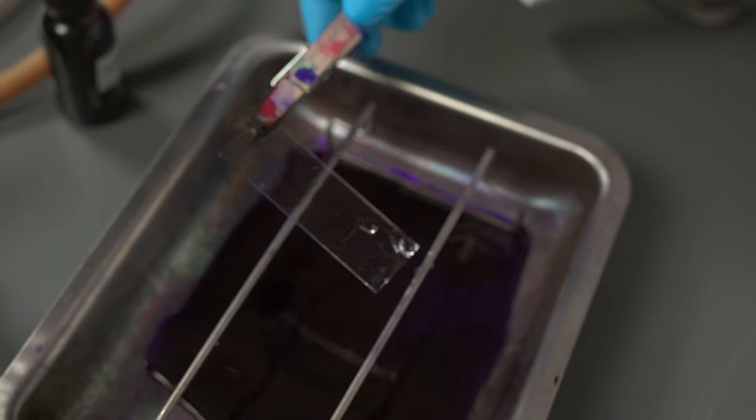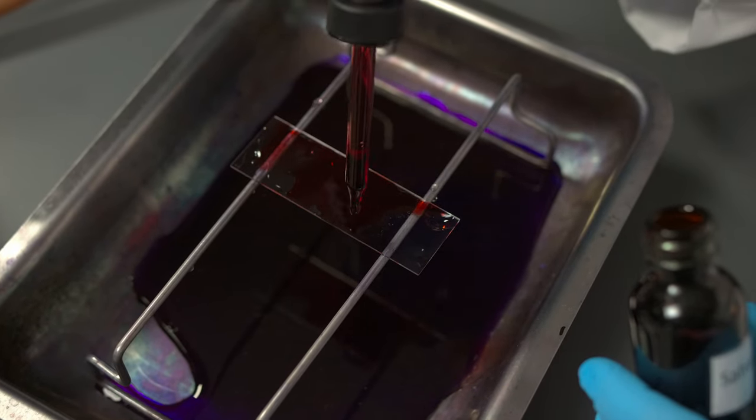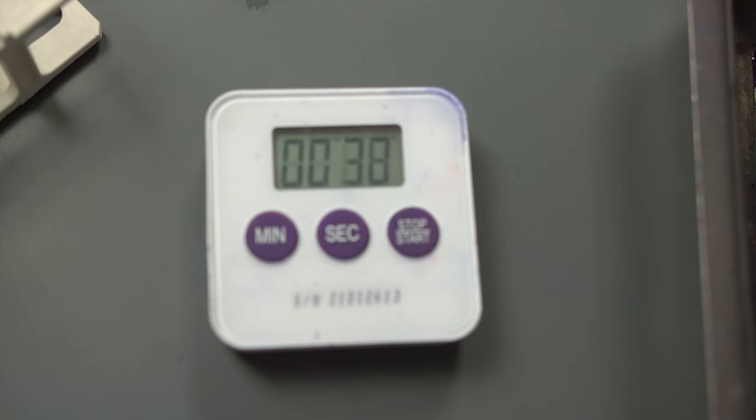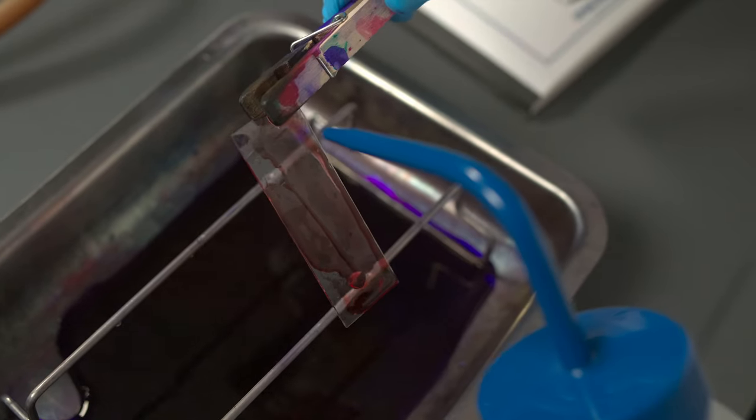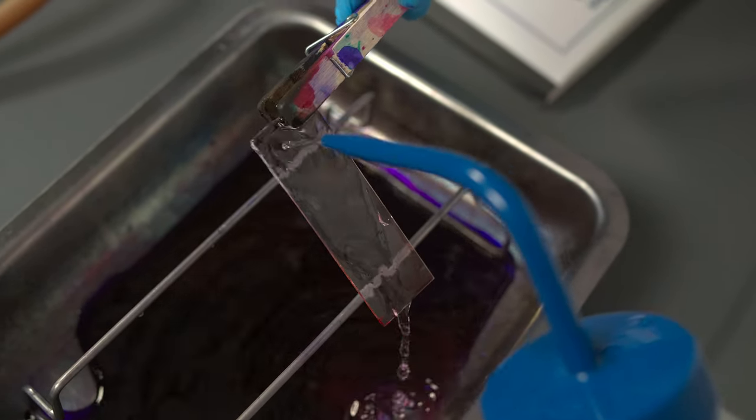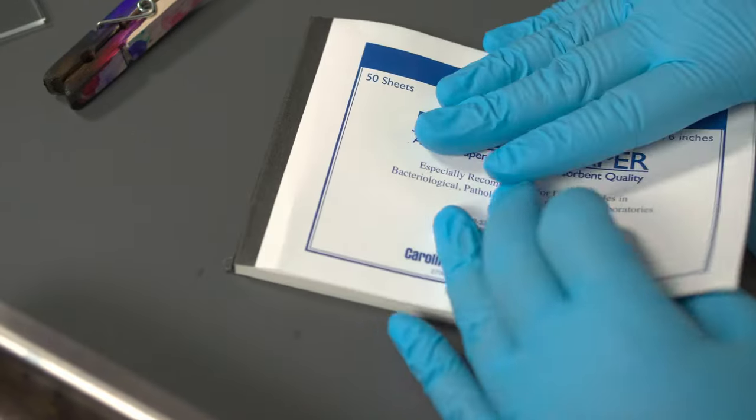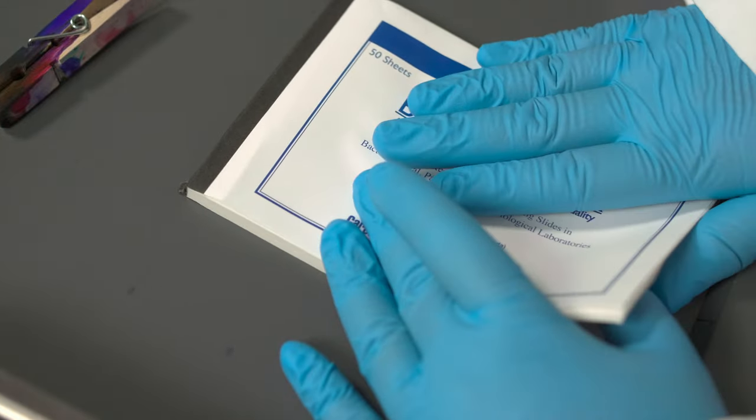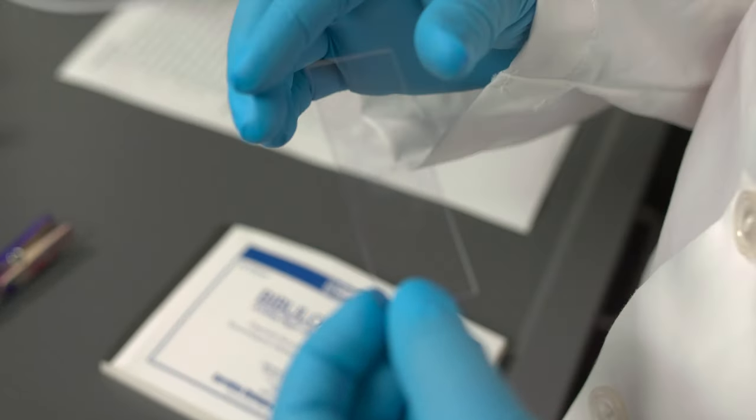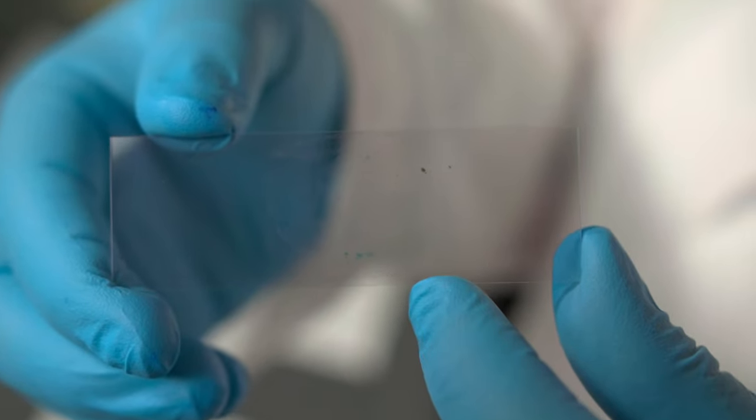Cover the smear with safranin for 40 seconds. Rinse the slide with water again, then blot the slide dry using bibulous paper. Your slide is now ready for use.